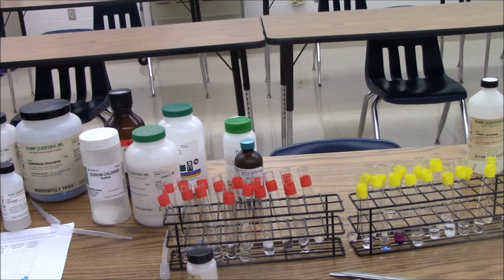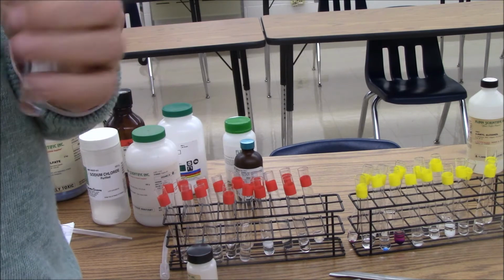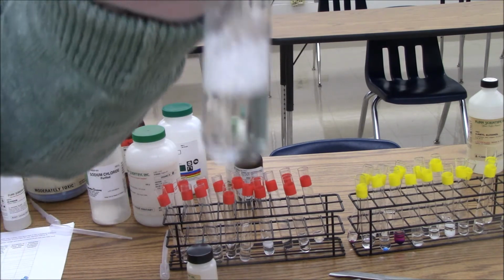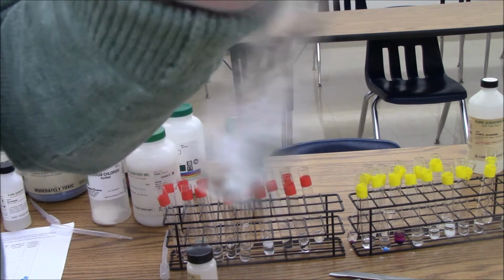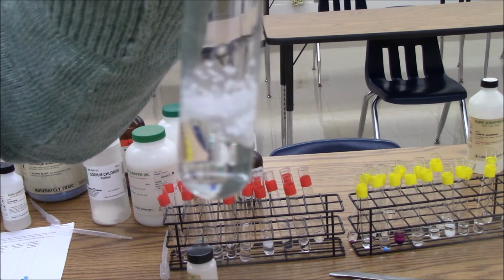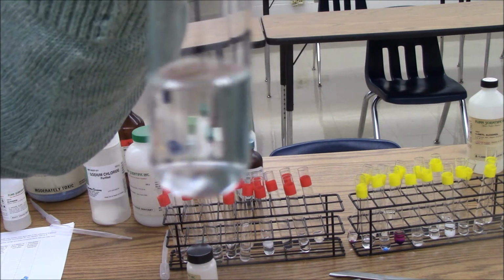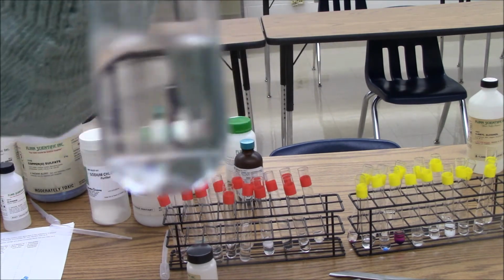Next up, we're doing palmitic acid. It's kind of a cousin to lauric acid. It's got 16 carbons rather than 12, but it's still primarily a nonpolar molecule, and it's also kind of waxy, low density, so it's floating on top of the water, but not dissolving. Here it is when I put a little bit in the hexane, it dissolves quite nicely.